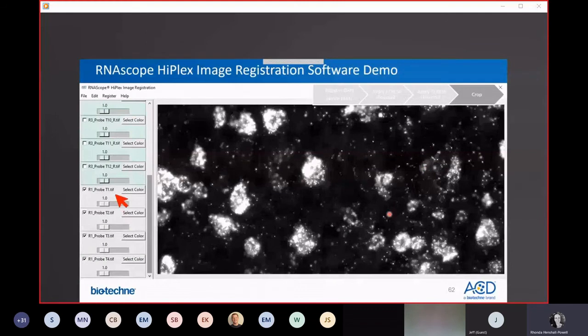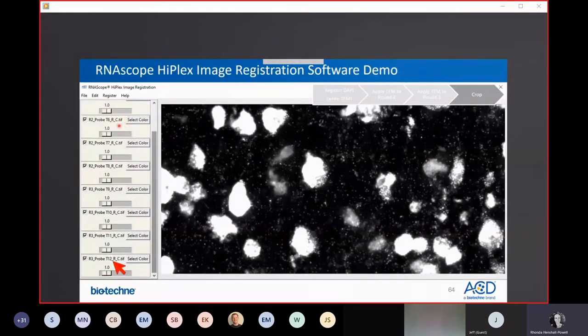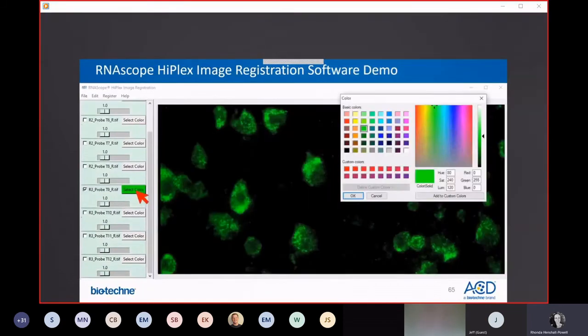and now they're added. And you can crop away the overhanging edges by selecting all of the files in the dashboard, going up to Register and selecting Crop Overlapping Region, at which point the file names are replaced with _C at the end, and they're highlighted in yellow to indicate that these now have all been cropped. And at this point, again, remove the redundant DAPI, which you don't need if you haven't already done so. And here, the software allows you to pseudo-color each channel whichever color you want for easy visualization of these different markers, depending on which you want to look at together at any one time.